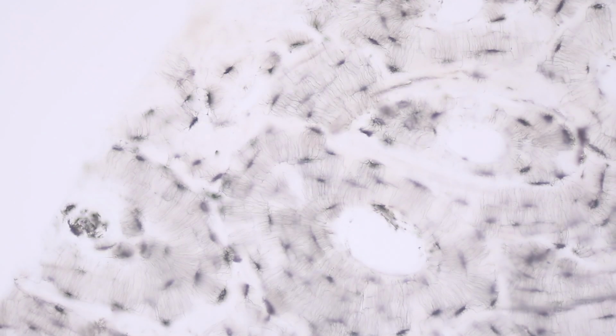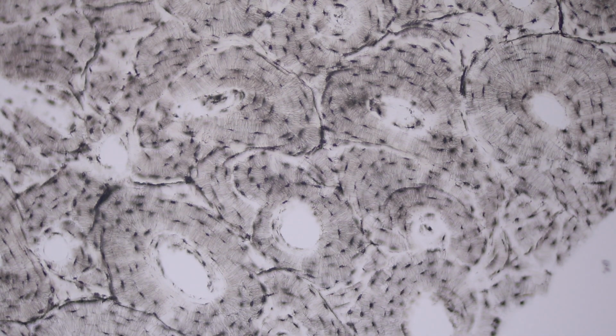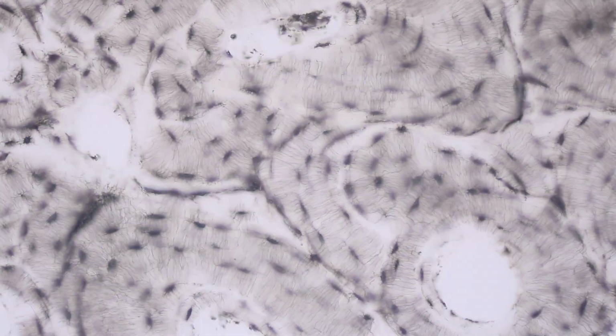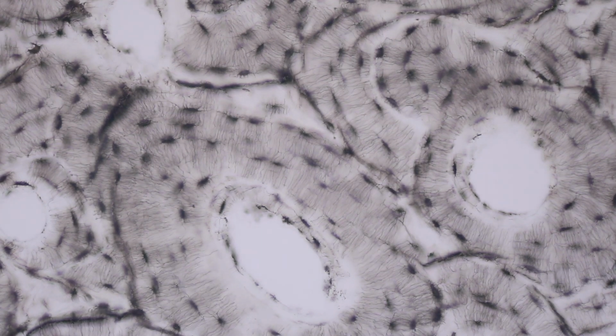There are 4 types of lamellar bone in the body. 3 of them are located within the cortex. To show you a good example of that, we're looking at a slide of bone tissue that is not stained with dyes, but is ground down and is very thin, so we can see several aspects.